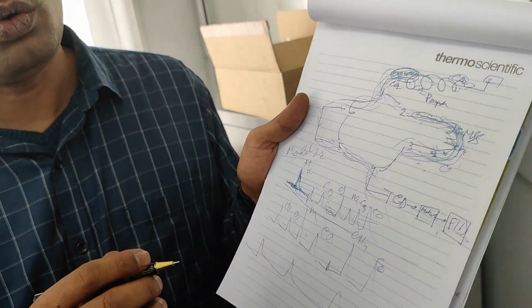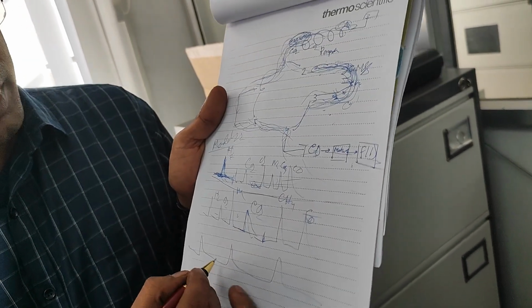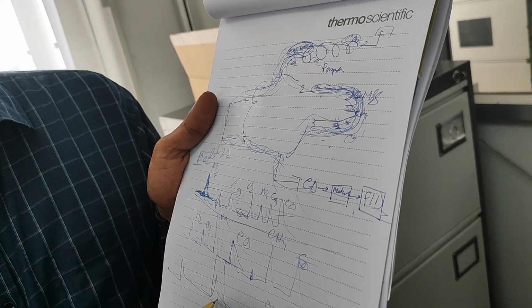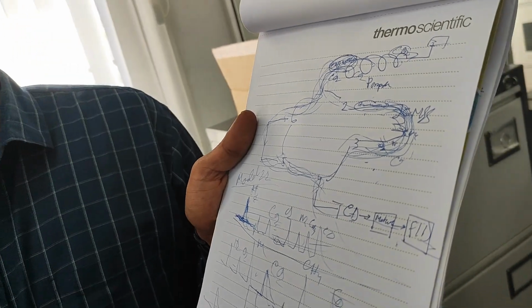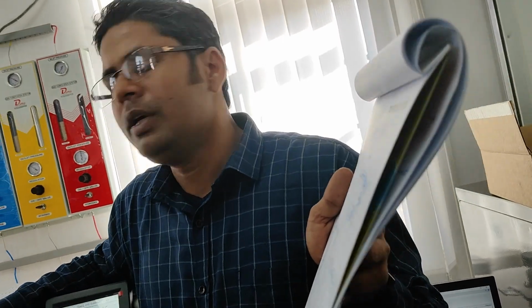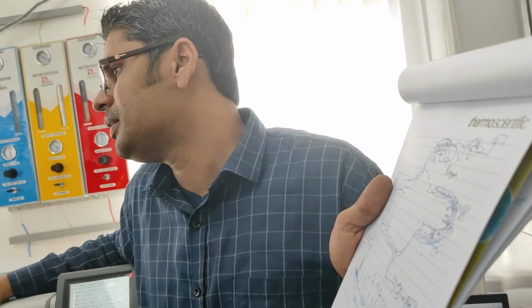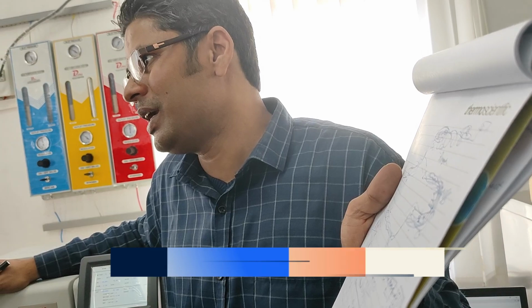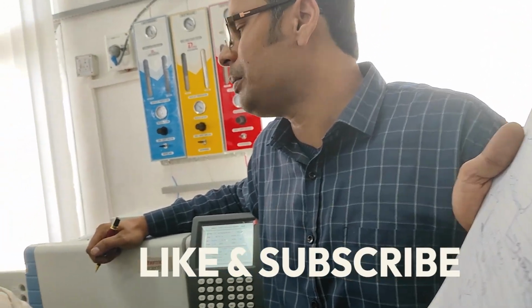If CO2 is at percentage level, you will get a peak in TCD. At the same time, you will get a very large saturated peak in FID, because it's converted into methane and FID sensitivity is very high, that peak will go beyond my capacity. So that time you have to delete this peak and take only this peak. Why did I say delete the peak? Unwanted. You cannot report twice for a single component, right? You have to report only one.